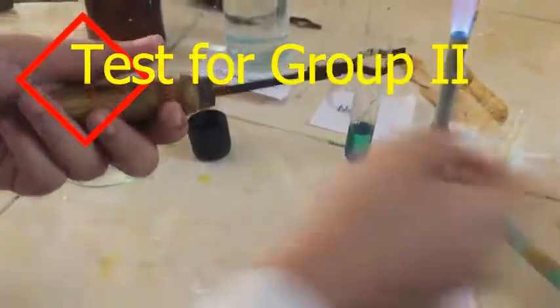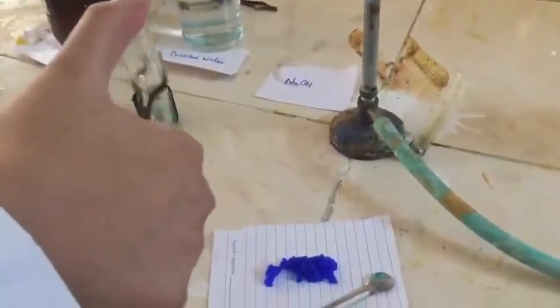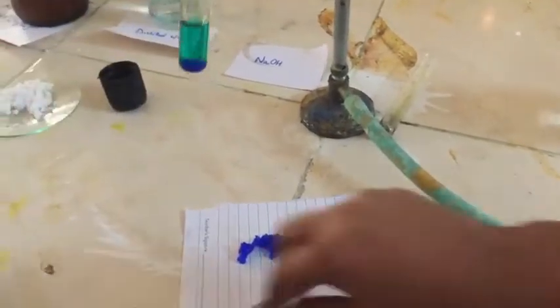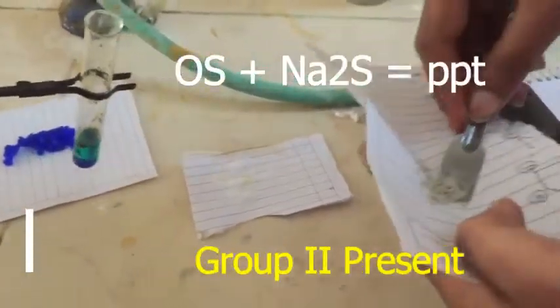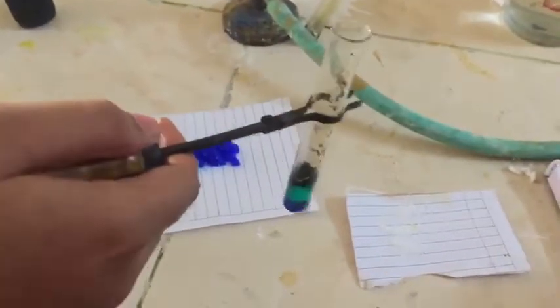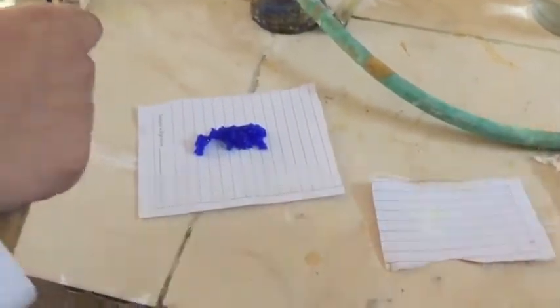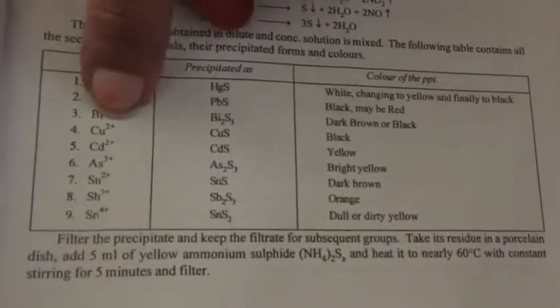The second group test includes two sub-groups, first and second. You can identify it by its color — it is copper sulfate. Adding sodium sulfide to this original solution gives a black precipitate, which confirms that copper of the second group is present.